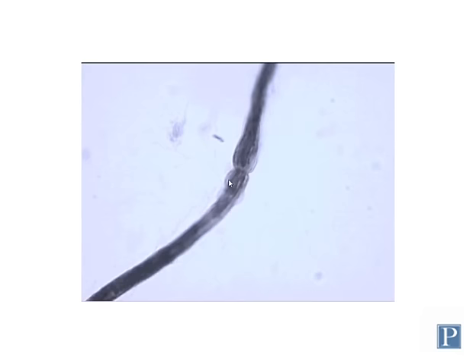This is an individual myelinated axon that has been teased out of a nerve. So this is a single axon, not a whole nerve fiber. This comes from a slide that has been stained with osmium tetroxide. Remember, OsO4 stains fats black, and because the myelin sheath is very fatty, it's really good for staining myelin sheaths of neurons. And you can see right here at this particular location, there appears to be a narrowing or gap where myelin is not present.